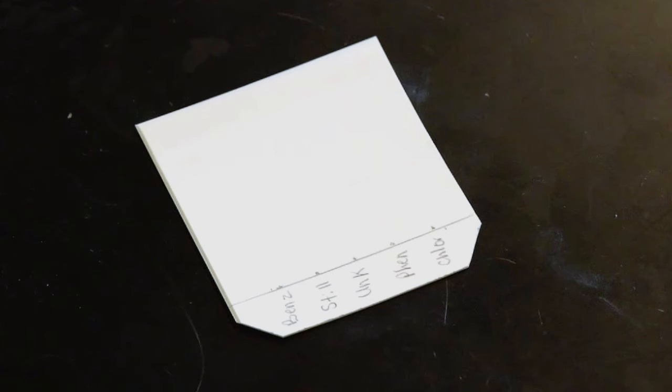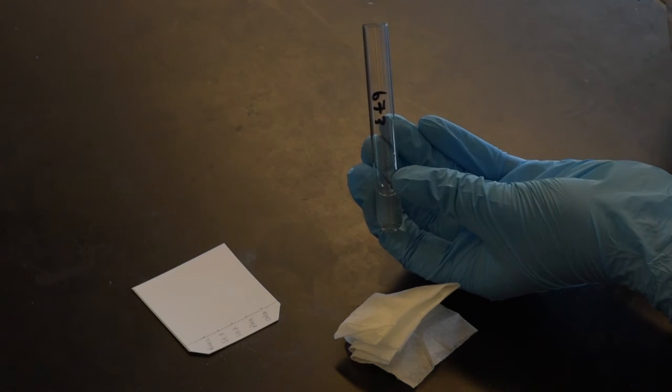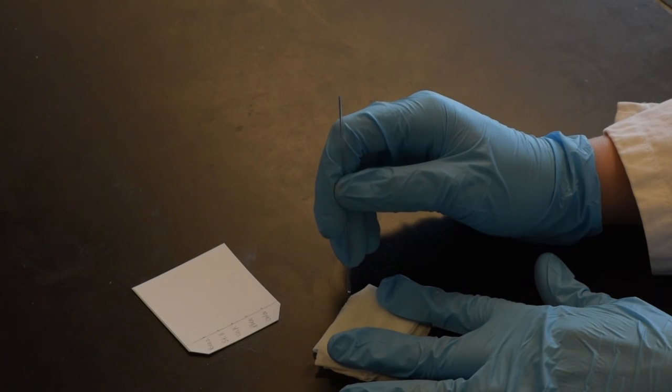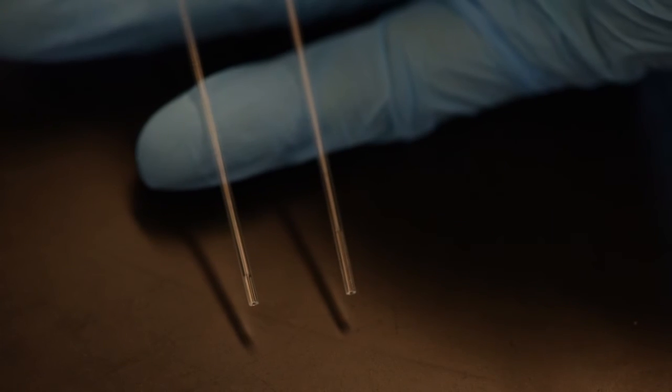Using a solution to spot the TLC plate is the technique which will be applied in most labs. In order to accomplish this, take a capillary tube and immerse the tip into the liquid you will be studying. Make sure not too much liquid entered the tube. If you feel too much liquid entered the tube, touch the end of the tube to some paper towel or Kim wipe to allow some liquid to drain out. An appropriate amount of liquid is less than 1 millimeter.